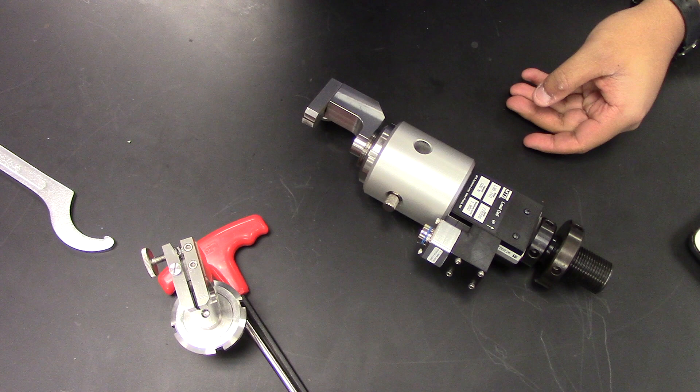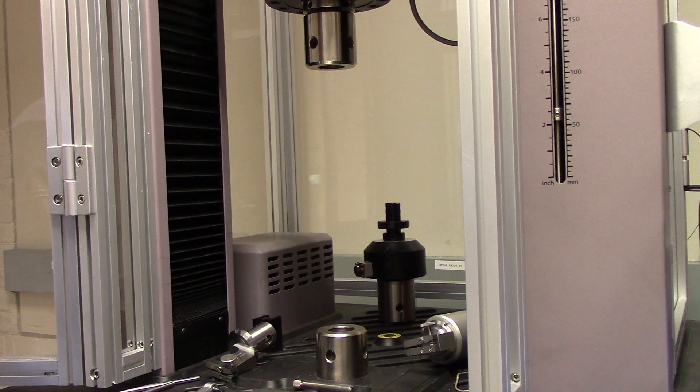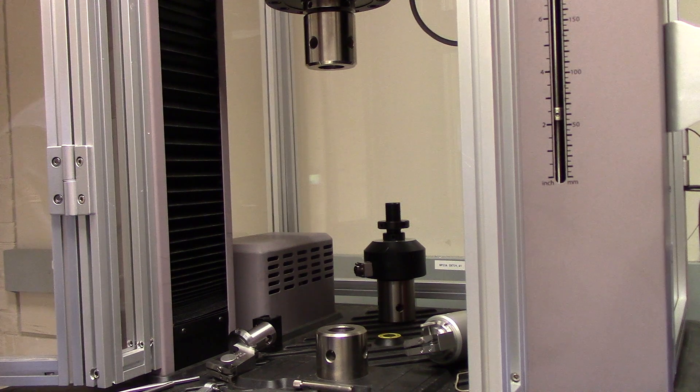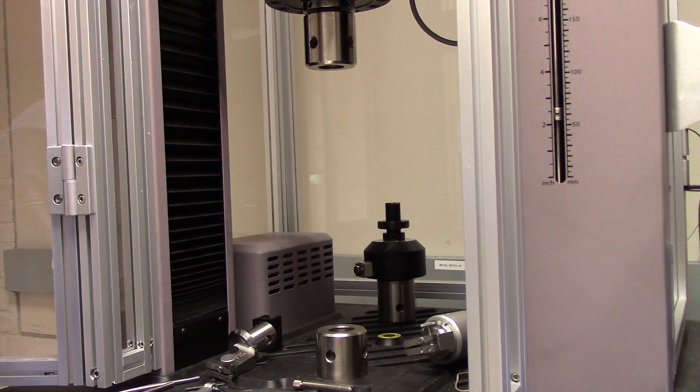Now that this setup is complete, let's switch over to the tensile tester. There are a few items that you need to modify in the tensile tester to accommodate for your low force setup.